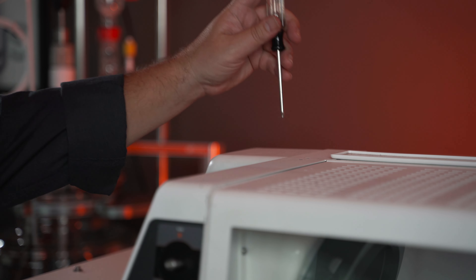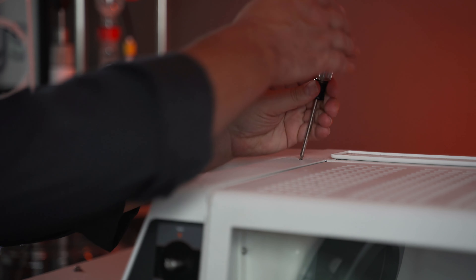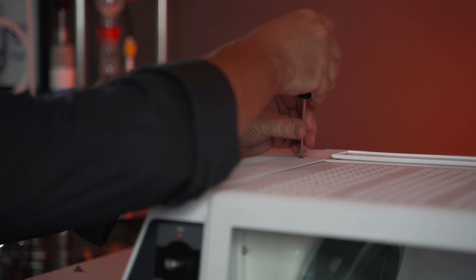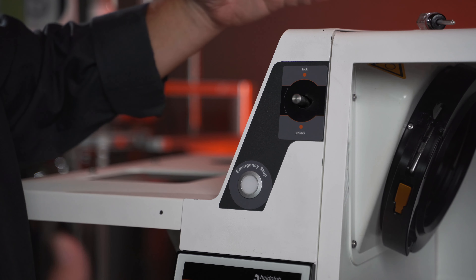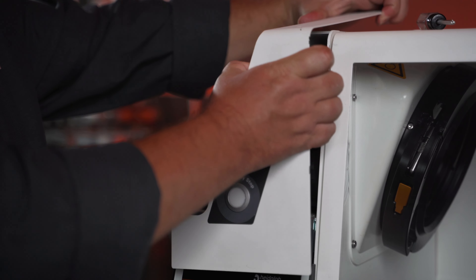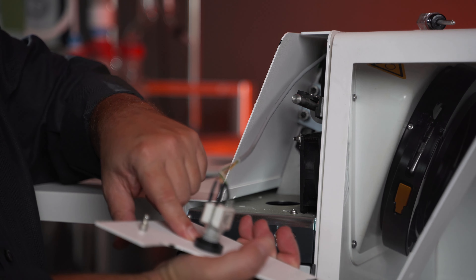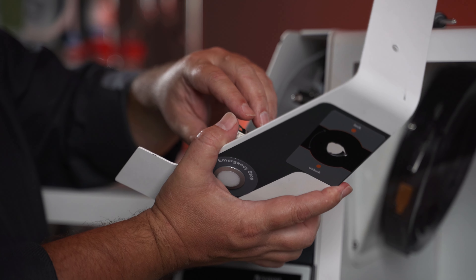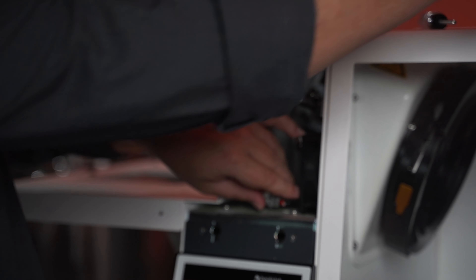On the top, to remove the first panel you have two screws — they are a T10 Torx drive. All we're going to do is remove the two top screws. Once you have the screws removed, this panel right here you can just pop it right off. There are two pins on the bottom that kind of snap into place, so you just have to push a little bit and pull it out. On the back side here, this is your emergency stop. If you have an older design like this, you will have this e-stop design — you can just basically turn, pull this out, and put the panel off to the side.